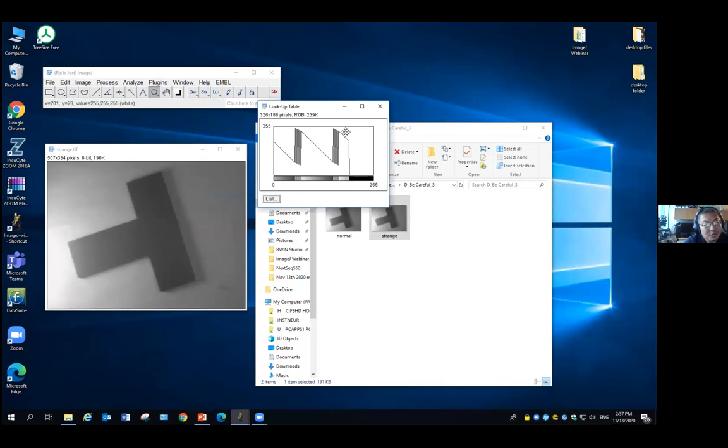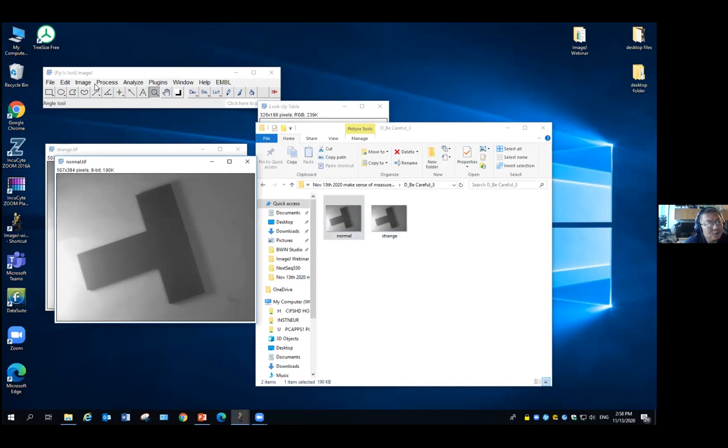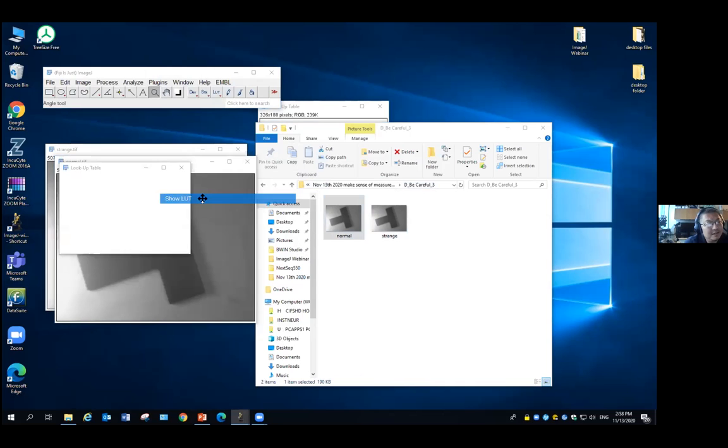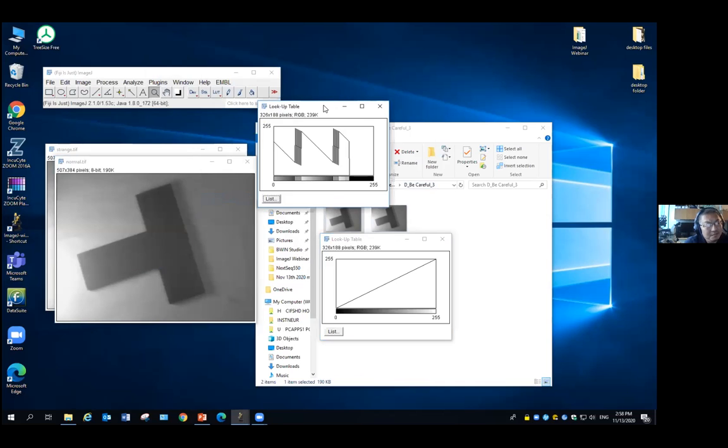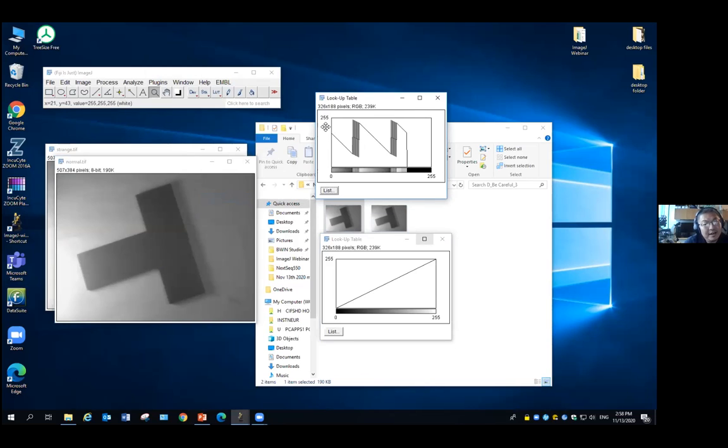This is a very strange lookup table. This is basically stored with the image to tell the software, when it opens, what kind of color to show based on the intensity value. A normal image lookup table should look like this: lower intensity showing up black, higher intensity showing up white. But here it has a very strange way to do it. This normally won't happen when you're using some kind of imaging equipment.